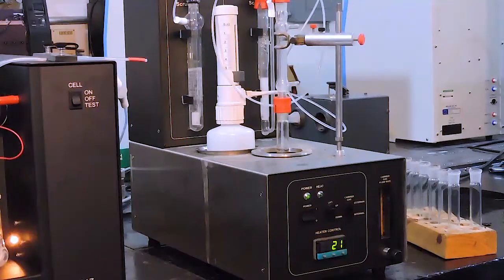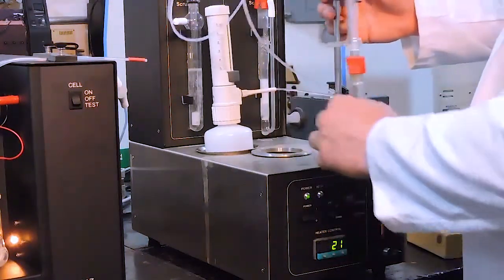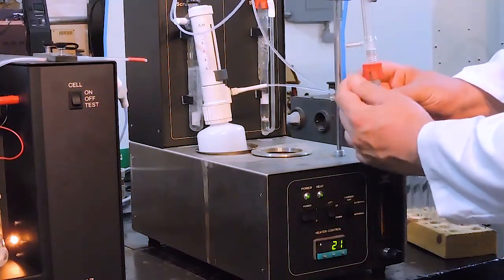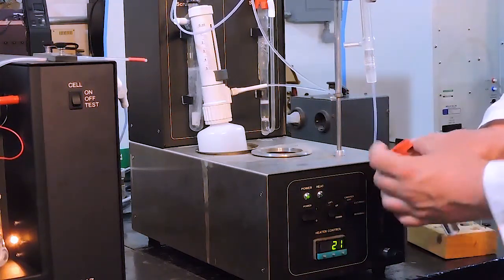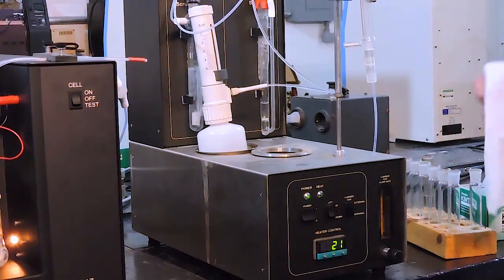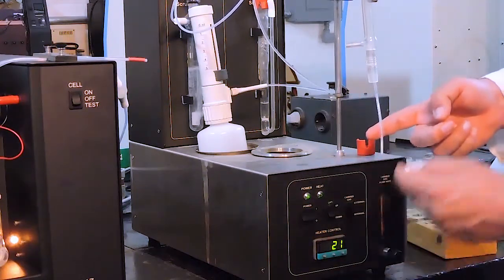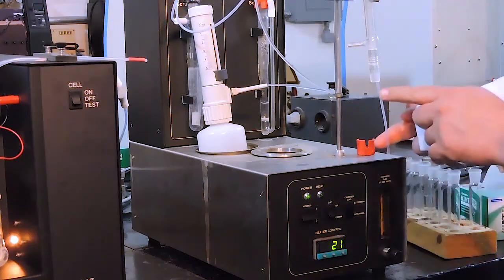To change samples once the blank is finished, press Lift Up, unscrew the red joint connector, and slowly pull the flask down. Use a clean Kim wipe to wipe the tubing for any acid that might be left over on the outside, and if you see bubbles of acid on the inside of the tubing, flick the tube a few times to get rid of the bubbles.